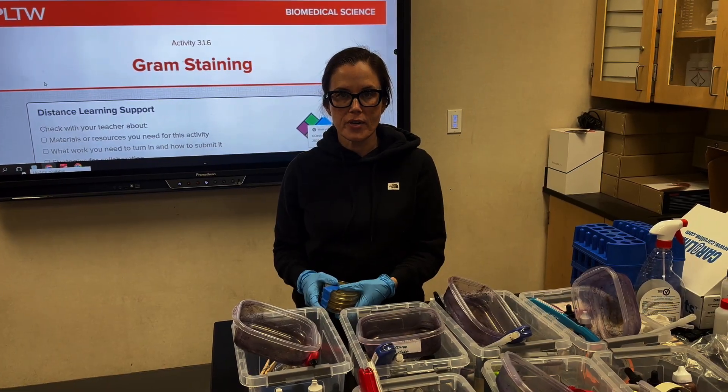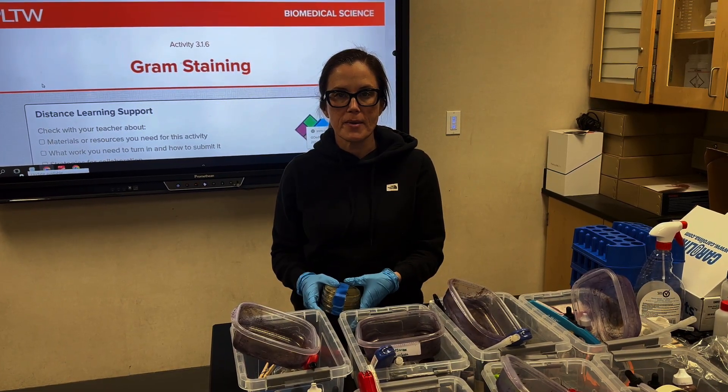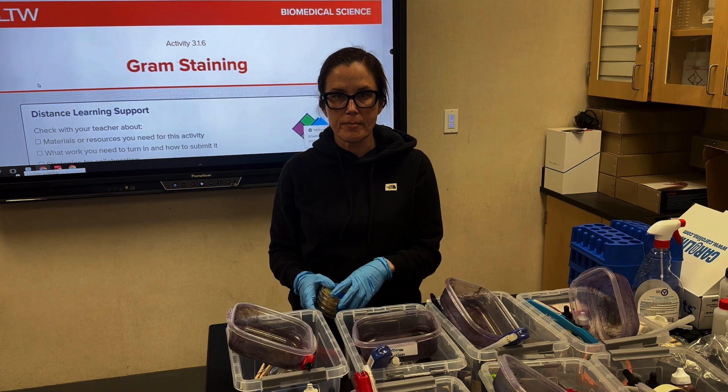Hi everyone, these are the Teacher Prep Instructions and Student Tutorial for PBS 3.1.6 The Gram Staining Lab.